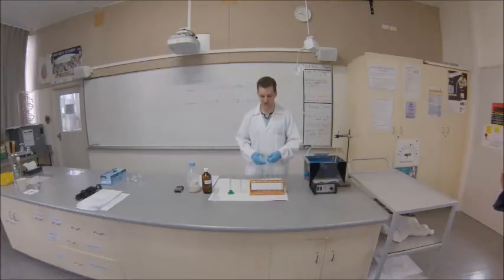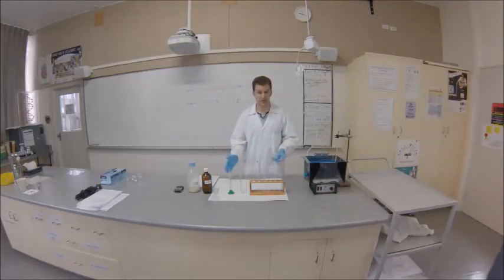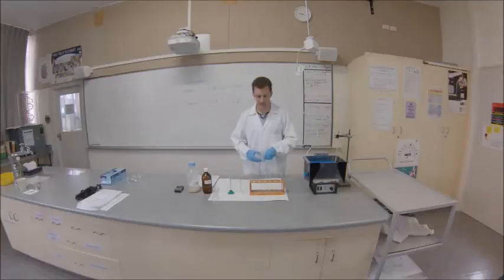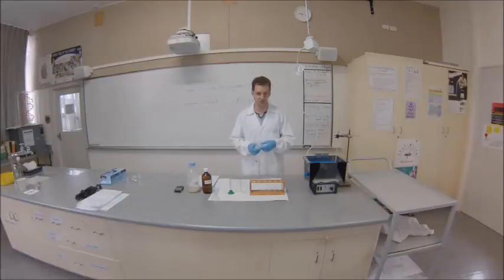Hi everyone. I'm going to run you through some of the basics behind this experiment. First thing: safety. Compared to some experiments, this is relatively safe, but we always take certain precautions.